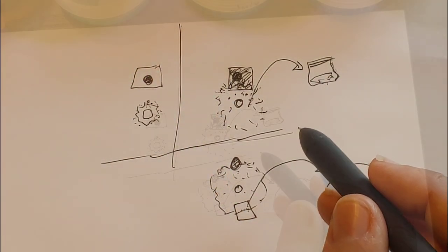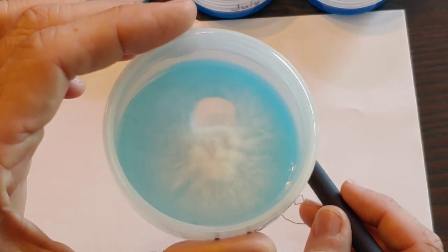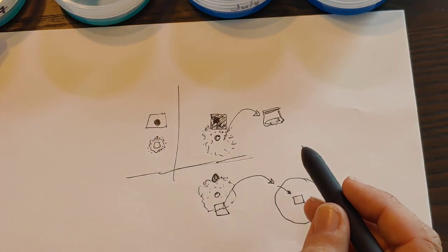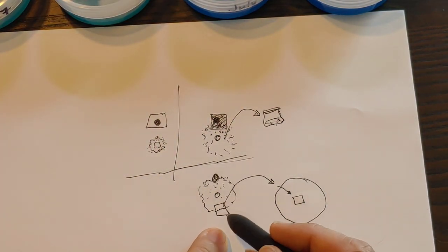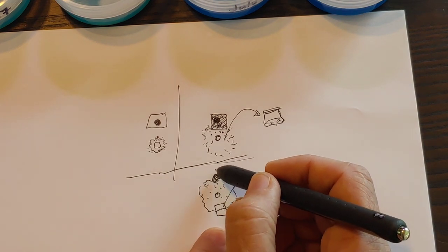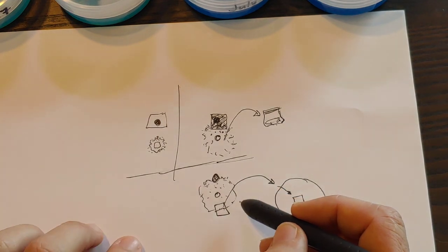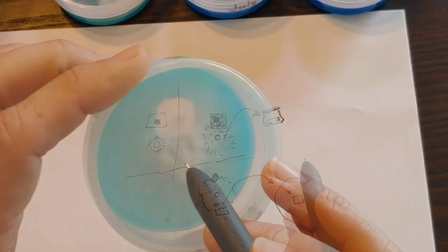But in a way, I wanted to test it because I've done it before, but I wanted to show you guys that there's another way to do it, even though people say never to do it. It can be done. This is safer because you leave the contamination behind and don't worry about it anymore. Here, you'll end up still worried about it. Well, what if it comes back?